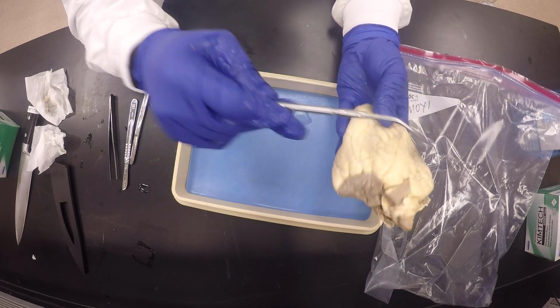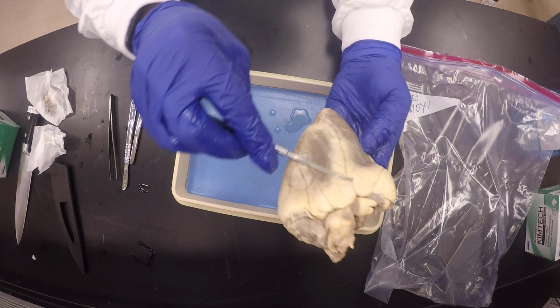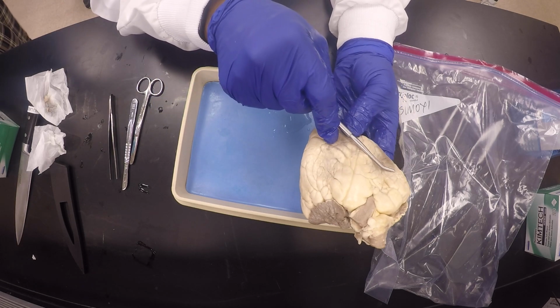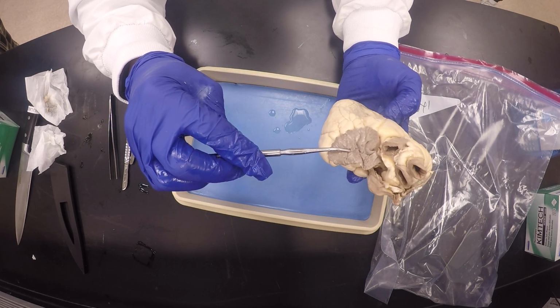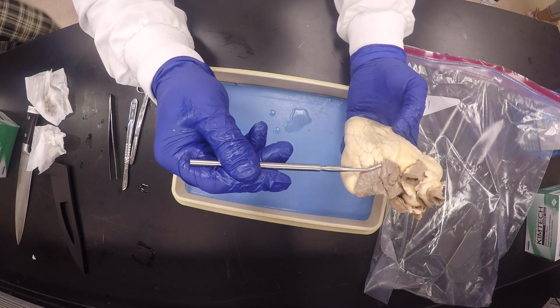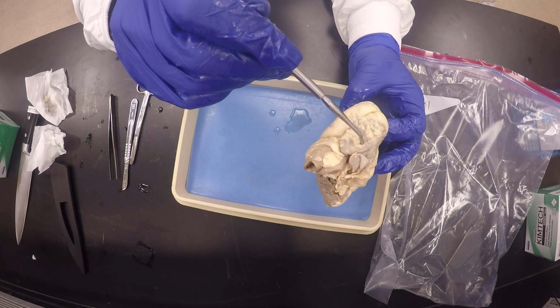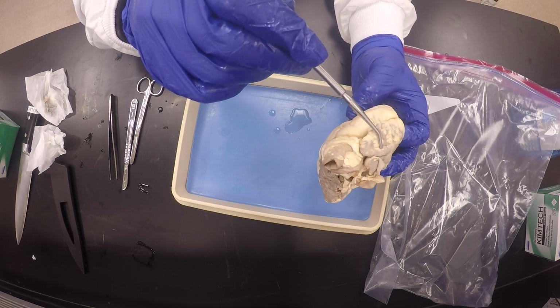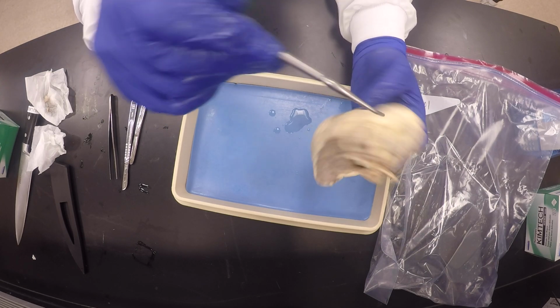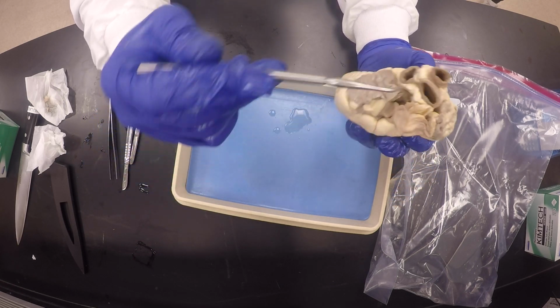So we identify the anterior interventricular sulcus, which is at a diagonal angle, and this is the posterior interventricular sulcus, which is vertical. Then this will be the left ventricle, right ventricle, and the left auricle, right auricle. If I say structure and I'm pointing here, left auricle. Structure pointing here, right auricle. But if I say blood vessel when I'm pointing to this right auricle, then you'll say vena cava, because it's the one that goes into the right atrium. Here on this side, pulmonary veins. And this is the pulmonary trunk, and this is the aorta.